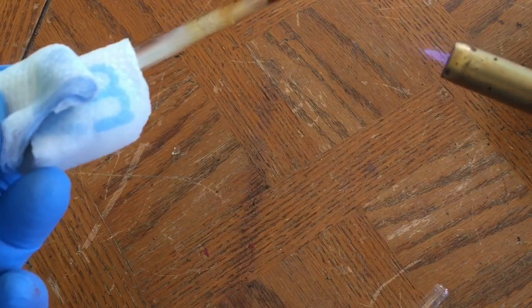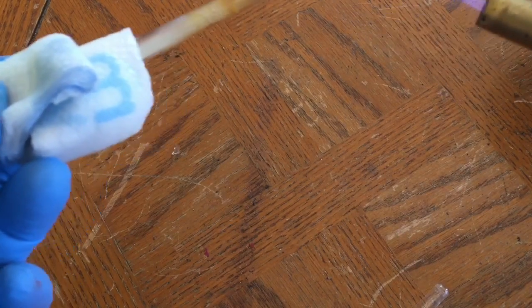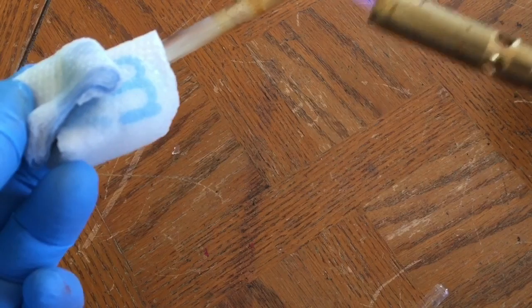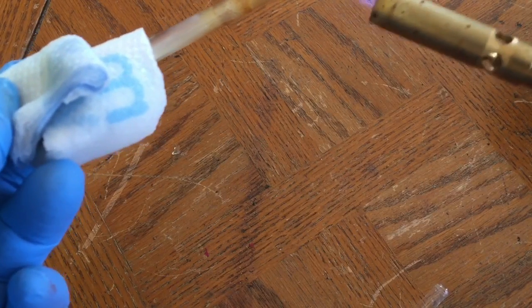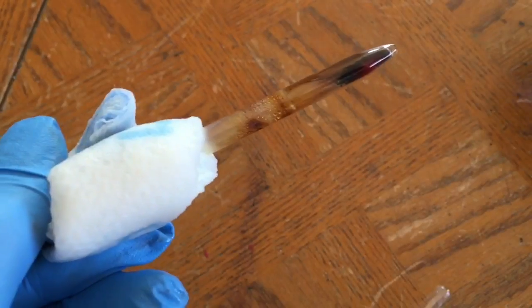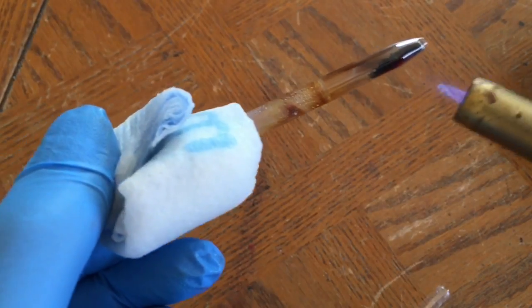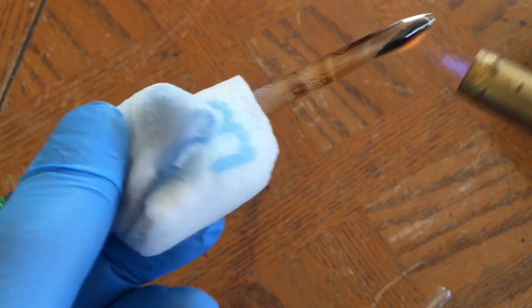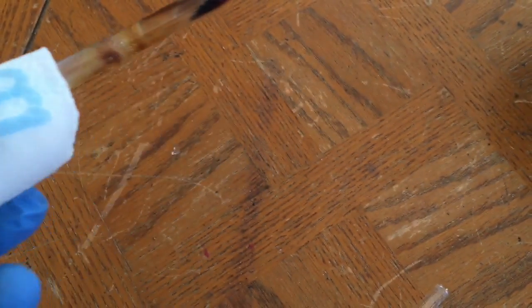I don't want to burn the paper residue that's mixed in with it. It looks like I've gotten most of it so I'm going to stop right there.